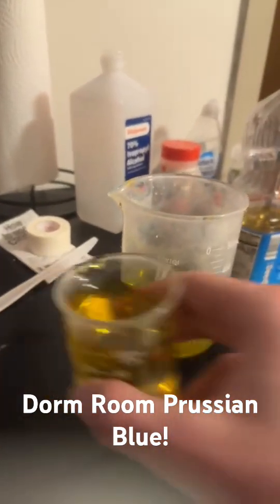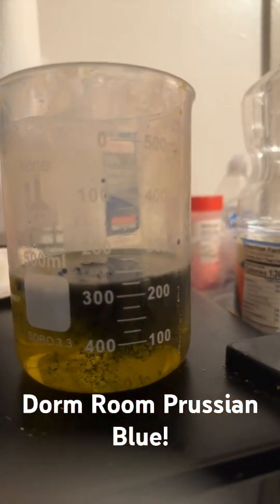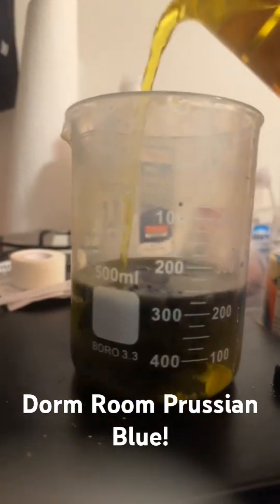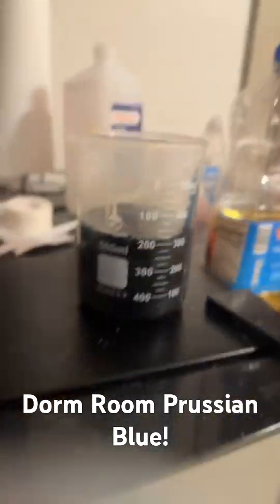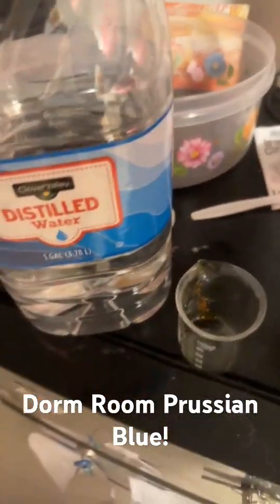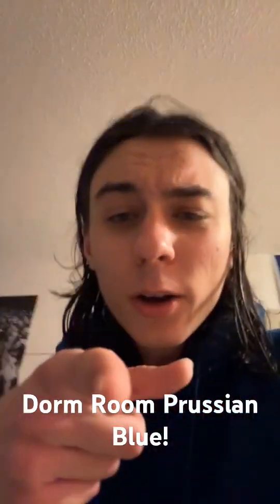All right. Then we take this and we just... Oh, yeah, look at that. Prussian blue forming. Just like that. Oh, yeah, look at all that. Oh, yeah, that's sick, isn't it? All that Prussian blue. It's all blue on the inside now, yeah? You like that? Yeah. That's really cool, isn't it?